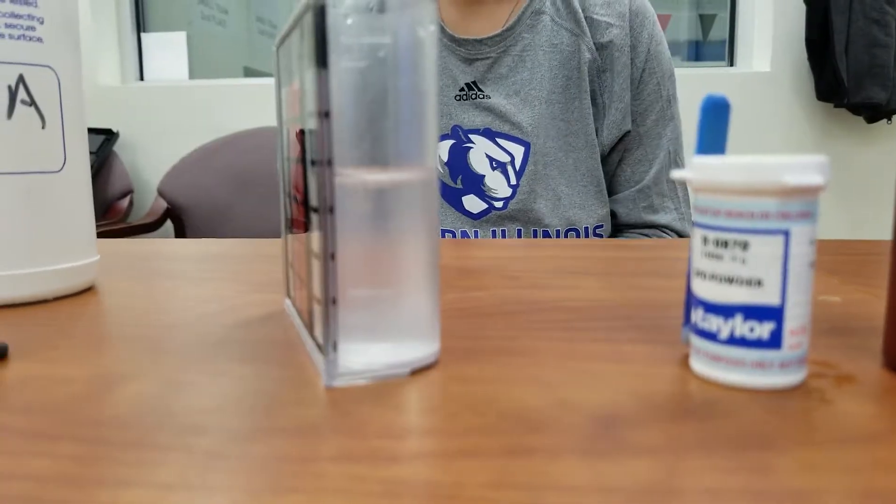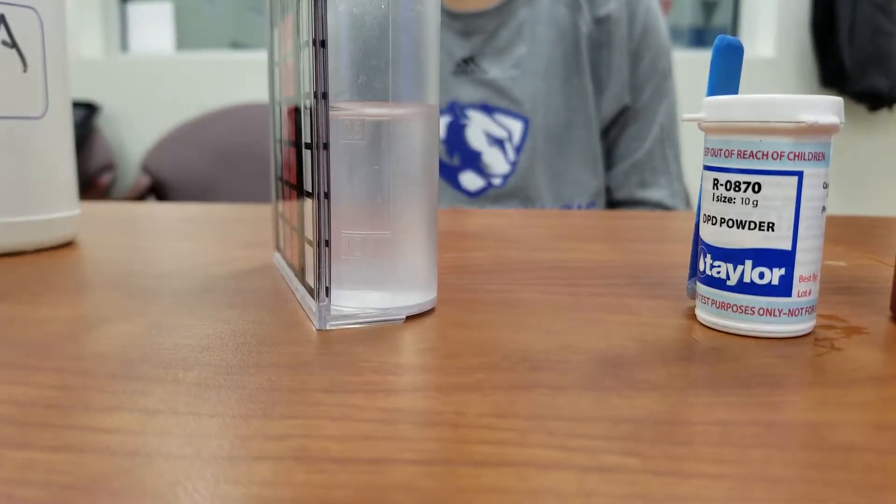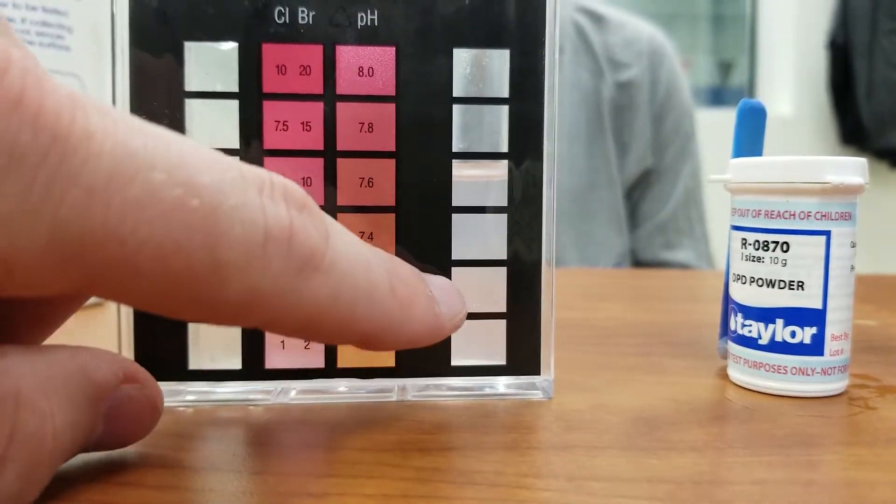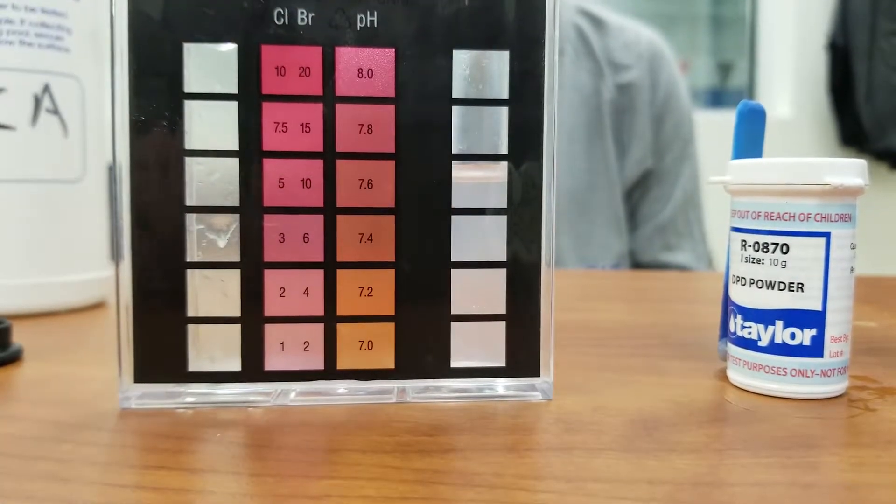This is a lot nicer because it gets us a lot closer. Instead of having to use these color matches to try to guess at what shade we're using, we just look for it to turn this clear color and we're good to go.